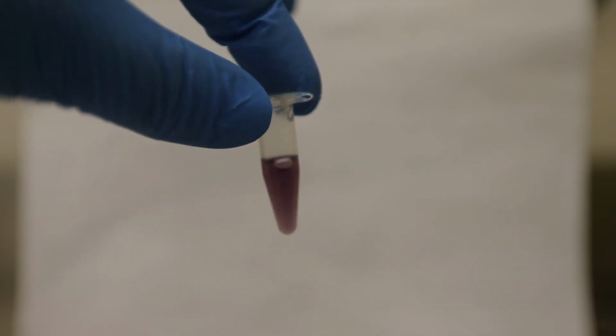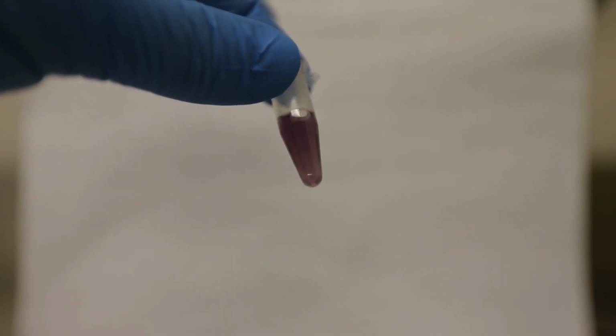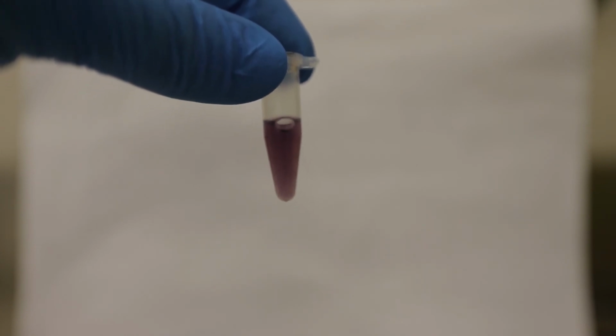So by following these suggestions for both the glucose standards as well as your food test samples, you will obtain the most accurate glucose measurements using this assay.